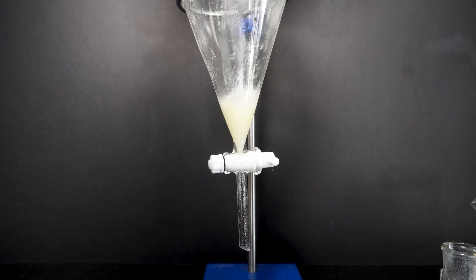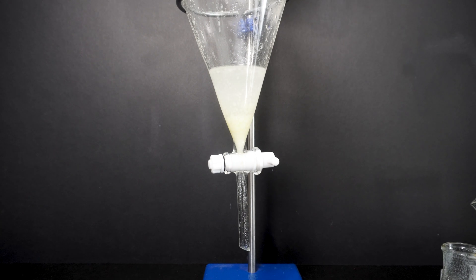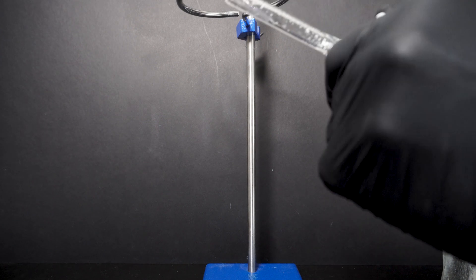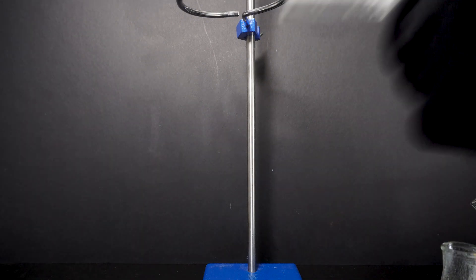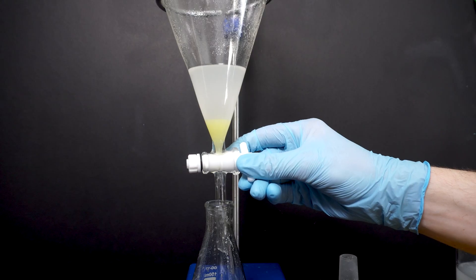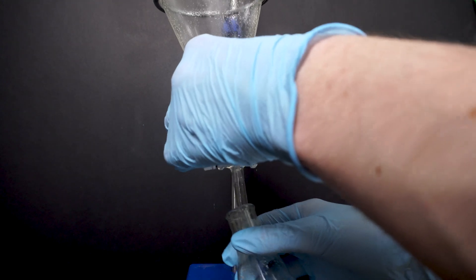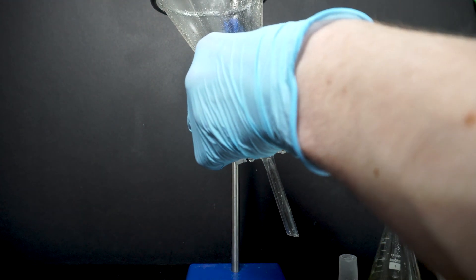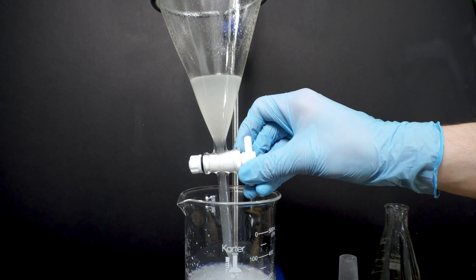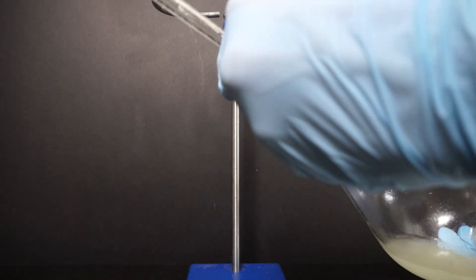Once again I transferred my methyl salicylate into the separatory funnel, and now I will neutralize the remaining sulfuric acid with a saturated solution of sodium carbonate. These two washings will each be carried out with 50 milliliters of water and 5 grams of sodium carbonate dissolved into each of them. Again we will cap, shake, and vent. However, with an acid-base reaction happening to neutralize, a lot of CO2 will be generated and it is important to vent frequently. This time draining is much easier, and I drain everything into the same flask as before. I also drain all of the water and other waste into the same beaker. However, this time there was some CO2 being generated because there was still some acid in the beaker from last time. I finally do one last washing step with sodium carbonate — it's the exact same procedure we just saw.